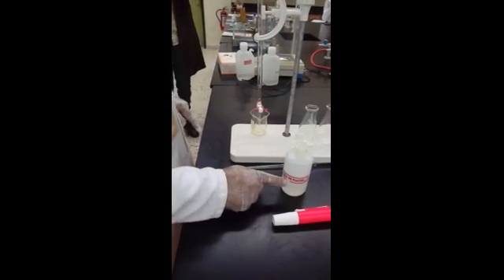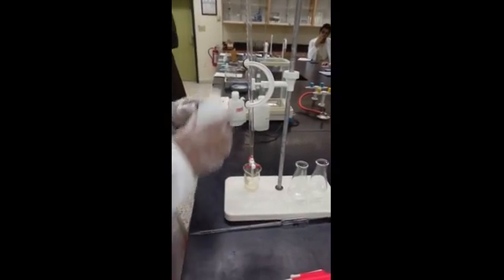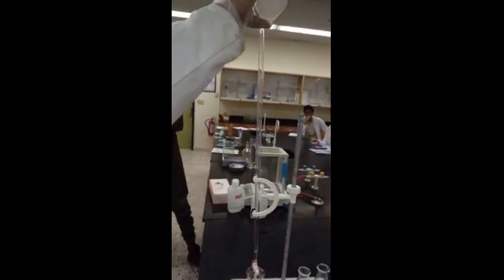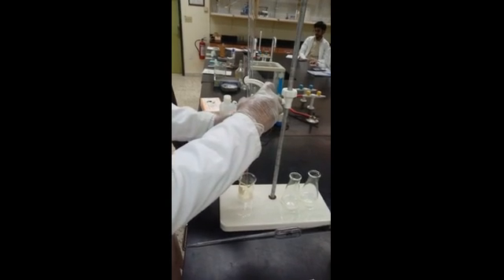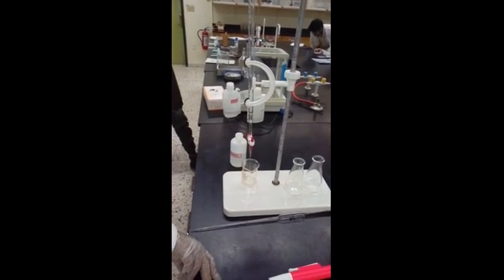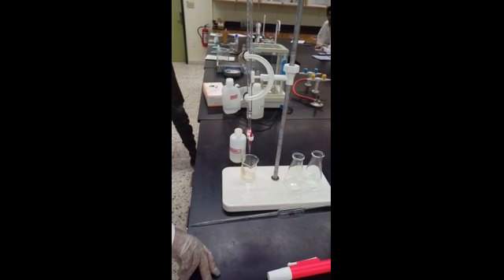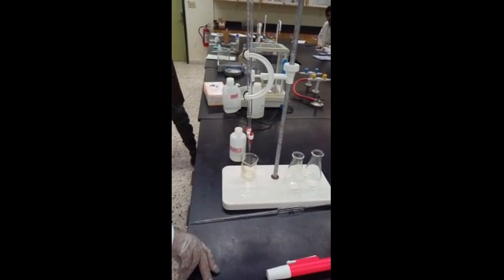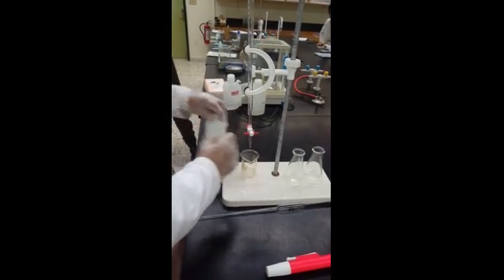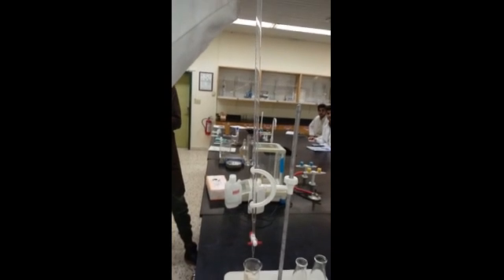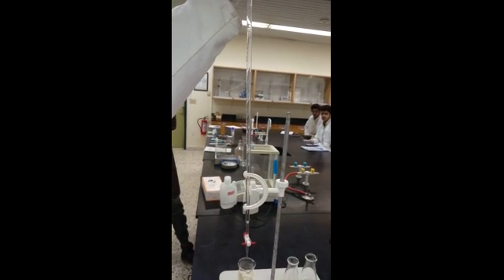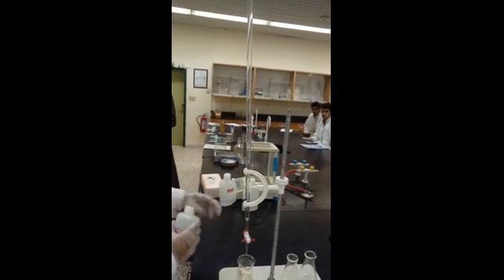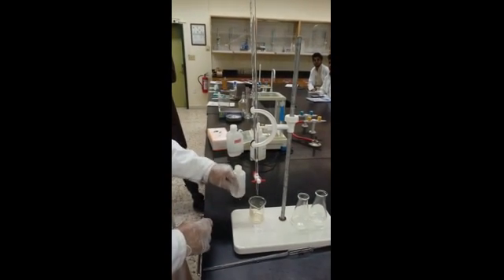What you do is fill the standard sodium hydroxide chemical into the burette. As usual, what we do? We add a little bit of the solution first. And we don't take this chemical. We open it and discard the solution to make sure that your burette is clean. And then you refill it up to 0 mark.